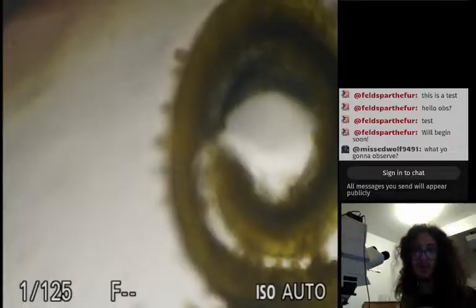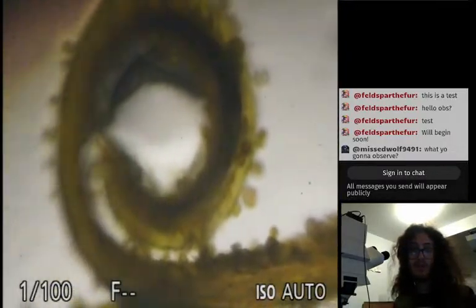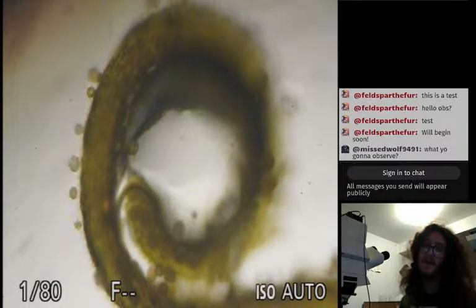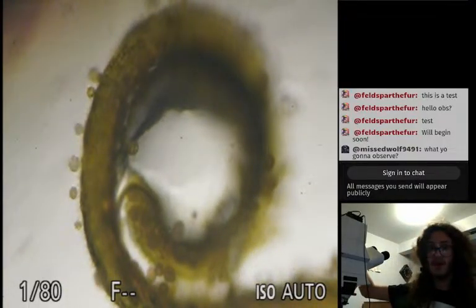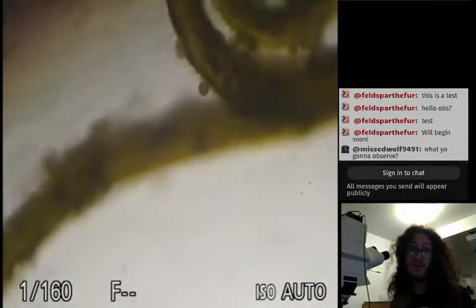That's kind of crazy right there. Plants are weird, man. There we go. And we have a little tiny guy that just keeps going, and that's the end right there.